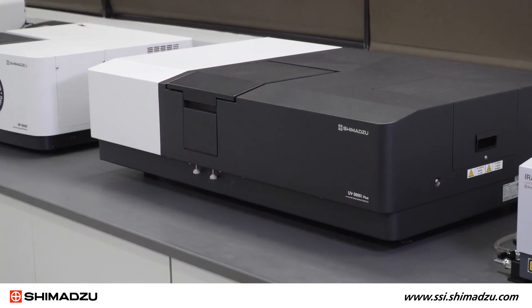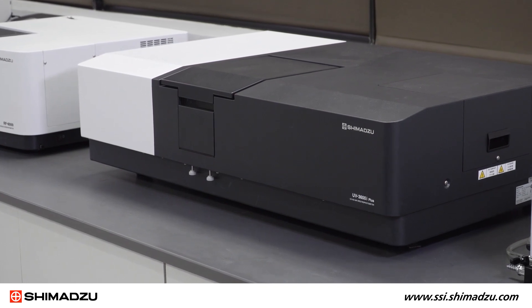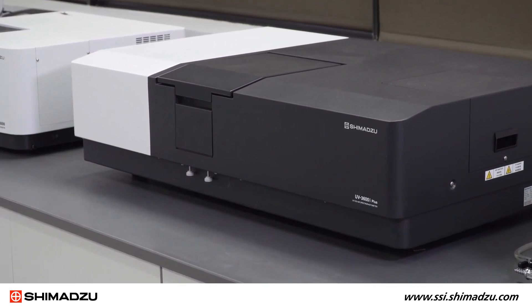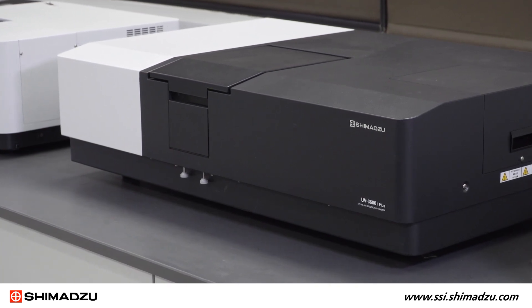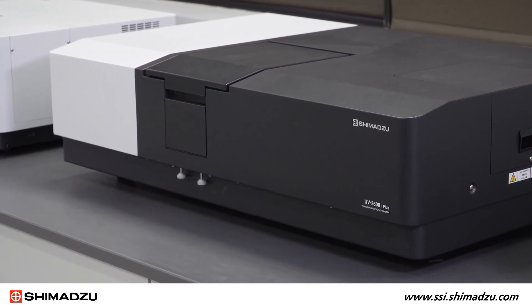Hello, my name is Gilbert Villal and I am the Product Manager for Molecular Spectroscopy at Shimadzu Scientific Instruments. In this video, I will demonstrate how to measure reflectance in your UV-Vis spectrophotometer using an integrating sphere. This video will feature our UV-3600i Plus instrument. However, this process can also be used on our UV-2600i and UV-2700i series instruments as well.